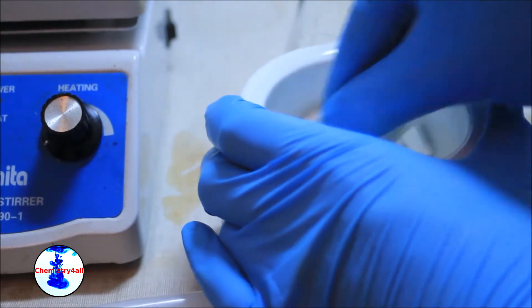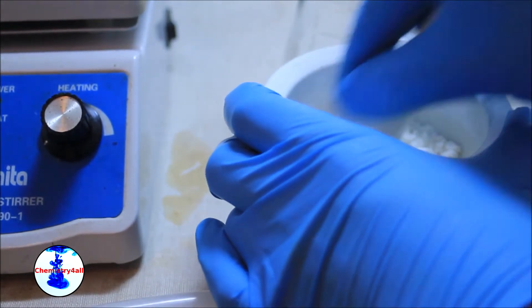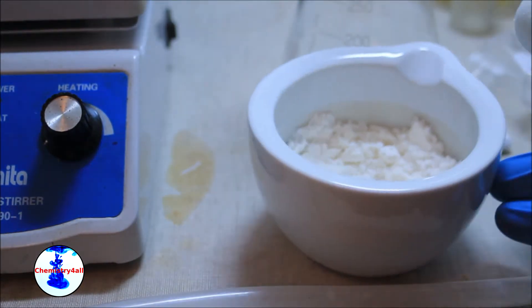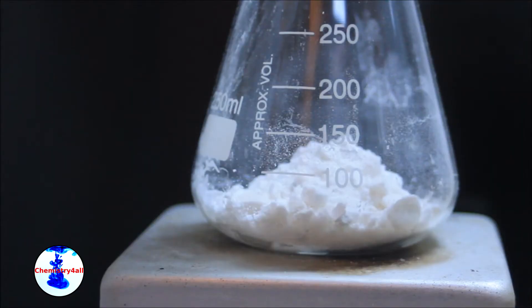Once the pills are mildly powderized the white solid can be placed in an Erlenmeyer flask in addition to a magnetic stirring bar. Then, the ethanol is slowly poured into the flask.